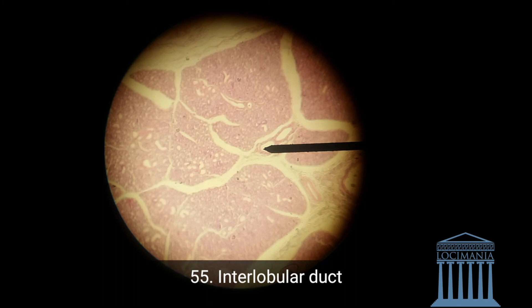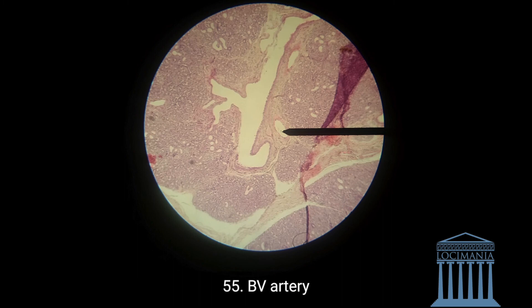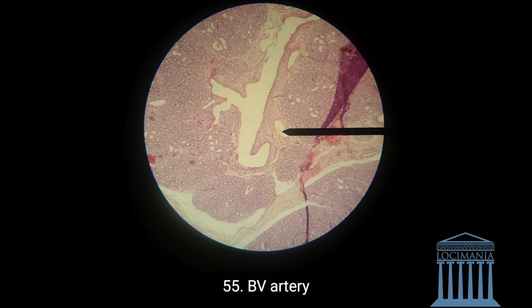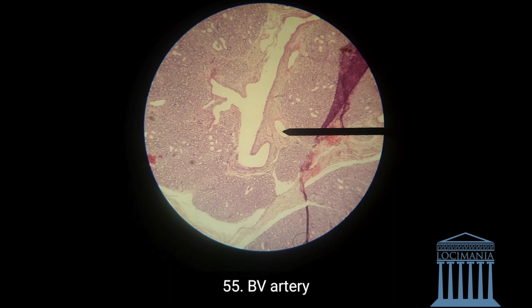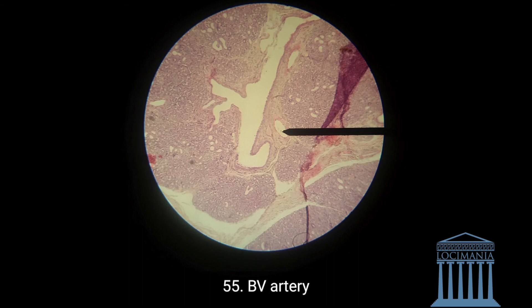Lastly, we have the blood vessels. The blood vessel is either round or oval, and if it's an artery it has muscle around it. This here looks like an artery. Veins, arteries, and white adipose tissue — all of that you have to know by heart. It's not too hard to memorize. That was all. Thank you and please come again.